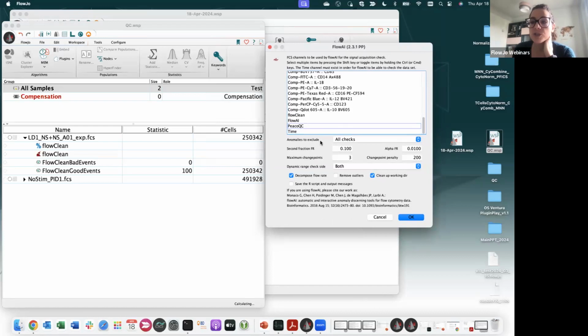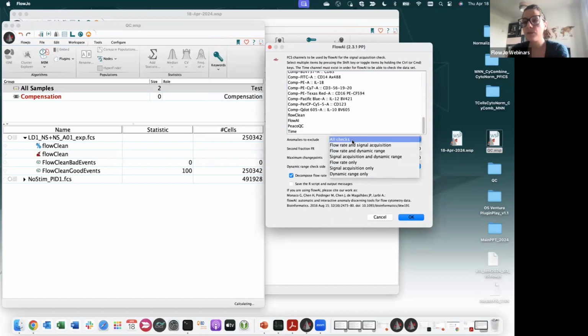Once I run FlowAI, I have different options right here. I can choose which anomalies to exclude: from all checks, or just from the flow rate and signal acquisition, or just from the flow rate and dynamic range, and so on. Now, one thing to consider is that if you generate a change of the flow rate, let's say you go from low to high, and then again from high to low, and from low to high, so you are basically shifting the flow rate, consider that the algorithm will see that and will automatically exclude all the events in this interval of time.